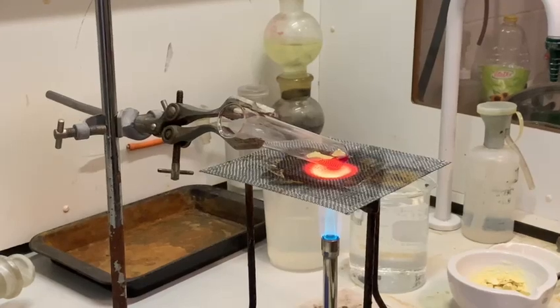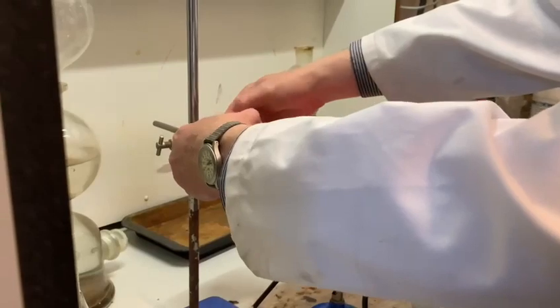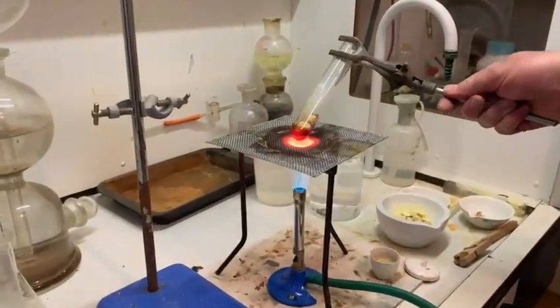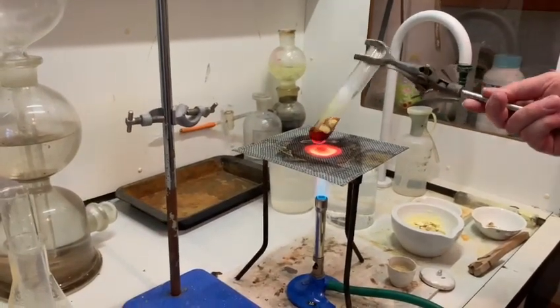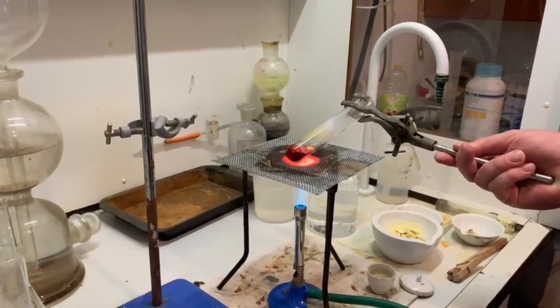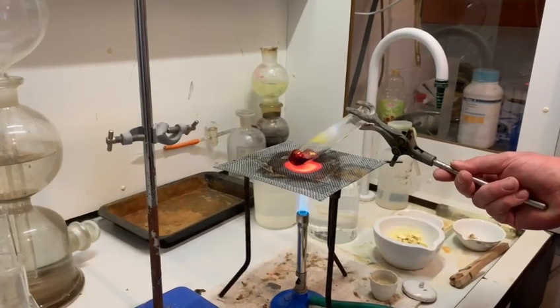If we keep heating it up, it changes from a yellow liquid to a very dark brown or red liquid at about 160 degrees. I did try this once with a thermometer, but unfortunately the thermometers kept breaking. I don't really know why, because I've had thermometers in oils at 300 degrees, but with sulfur it seems to keep splitting them.